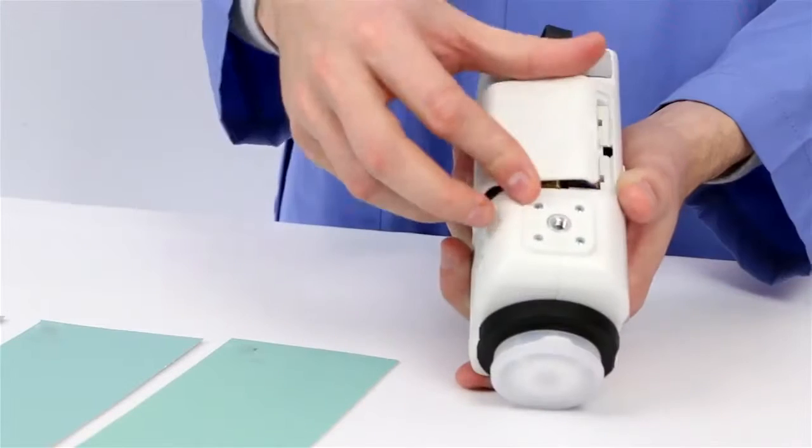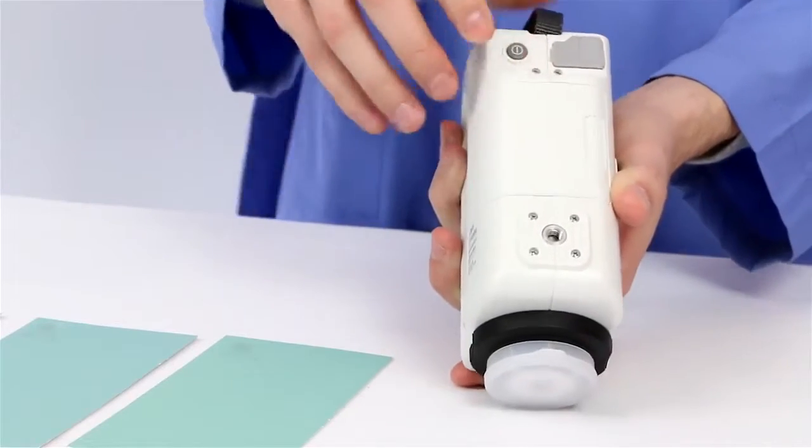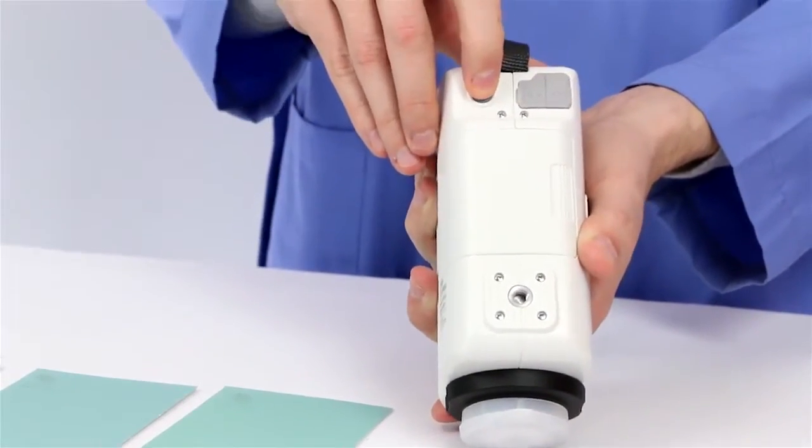Switch the instrument on with any one of three power sources, including batteries, AC adapter, or USB cable.